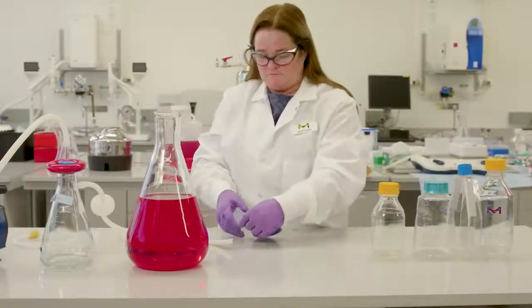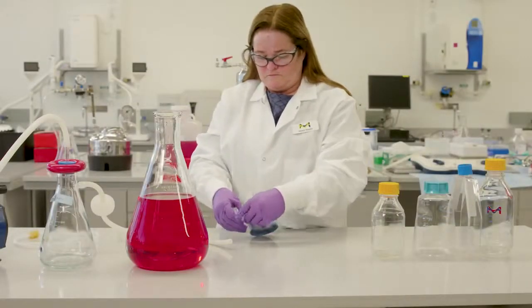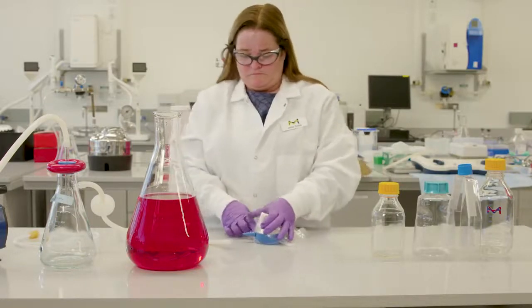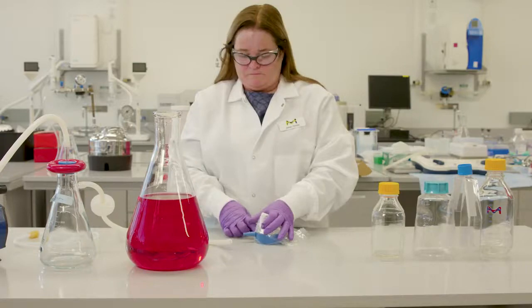Procedure. Remove the filter unit and the tube set from packaging. Peel open their pouches using aseptic technique under a laminar flow hood or in another sterile environment.